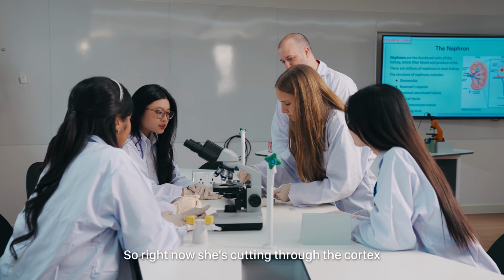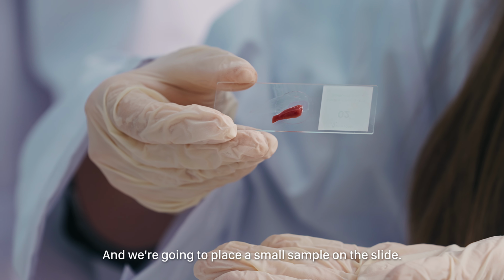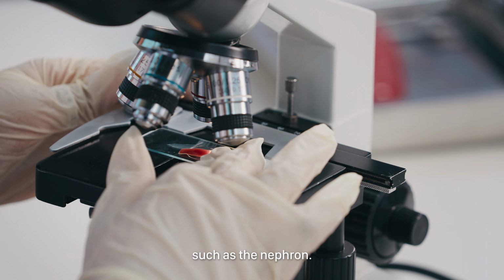So right now she's cutting through the cortex and the medulla of the kidney. And we're going to place a small sample on the slide. So under the microscope, we're going to be looking at some microstructures such as the nephron.